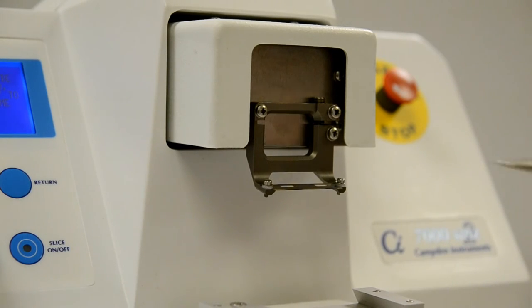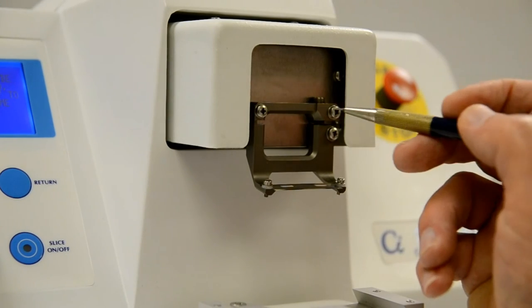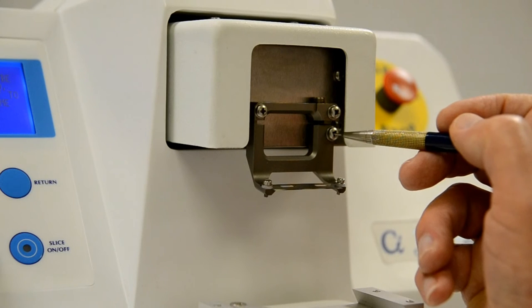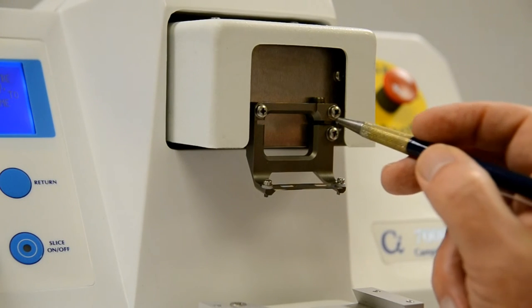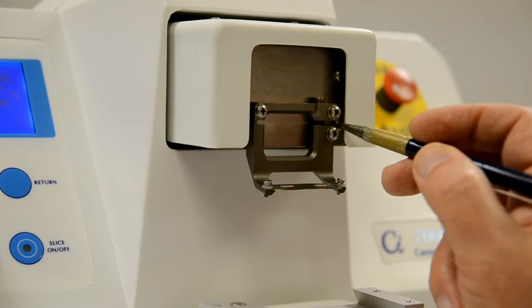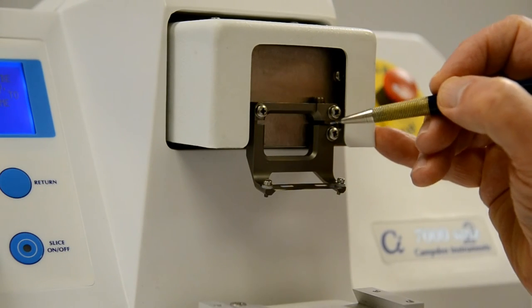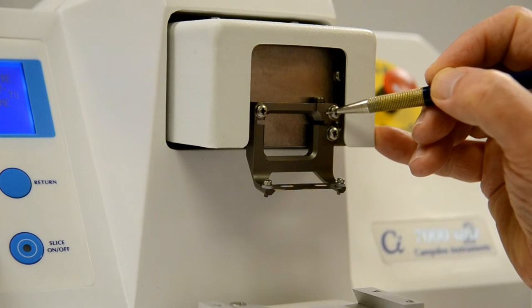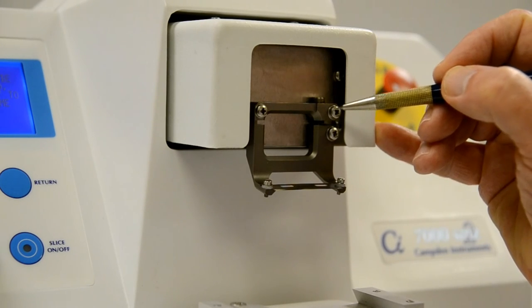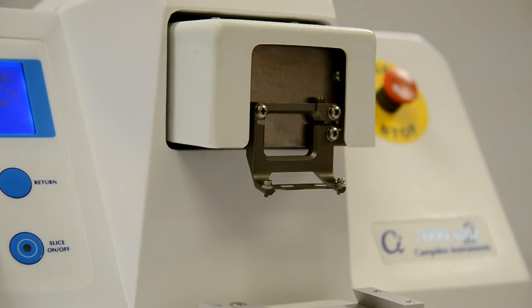If you look closely at the blade holder, you will see that it is secured to the face plate of the cutting head by three screws. You will also notice that the blade holder has an open slot in its right-hand side. A differential screw mechanism arranged vertically within the blade holder across the slot allows fine adjustment of the slot width to be made. By adjusting the slot width, we can change the angle of the blade edge relative to the cutting head and thus to the lateral vibration axis.